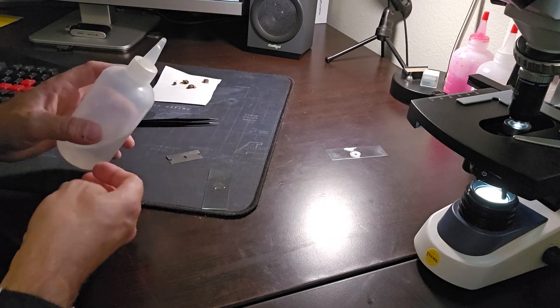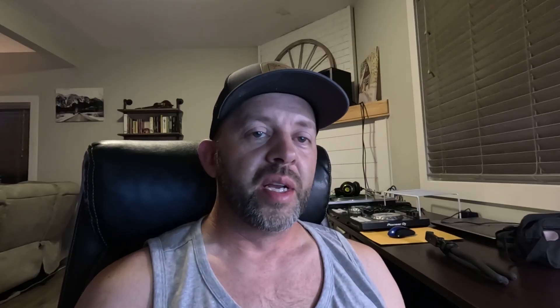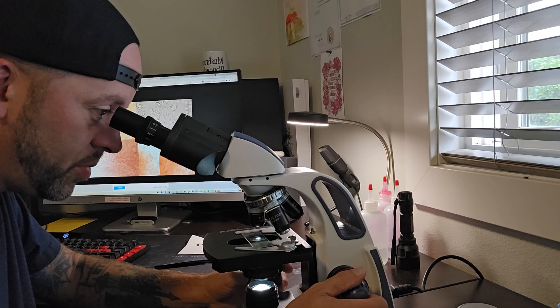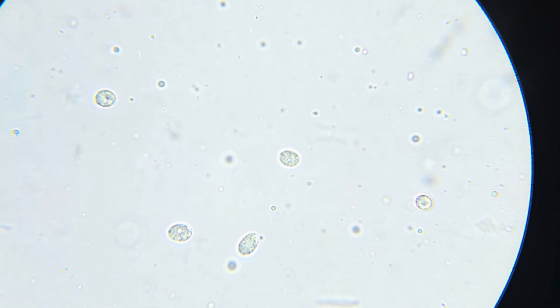So I cut this little piece of gill off, I put it on the microscope slide and I put a drop of KOH on there and it rehydrates. Then I put this cover slip on top and use the back of my tweezers to kind of smash it down ever so lightly — so as not to break the glass or completely smash the fungal specimen, but just to spread it out onto one focal plane so that I can see the fungal structures. When I put it into the microscope, I was delighted to see there were a lot of spores coming off of this little piece of fungal tissue. This really super minute little piece of tissue that you can barely see with your human eye has quite a lot of spores on it — meaning that just one of these little tiny dried mushrooms is making probably millions of spores, and there are a lot of these little mushrooms in the woods.